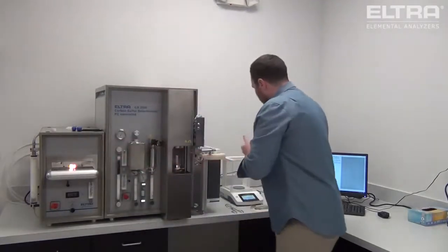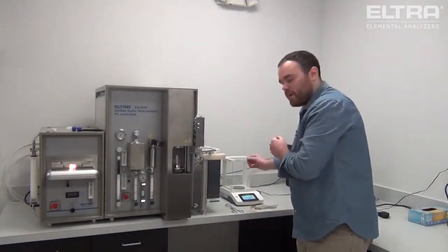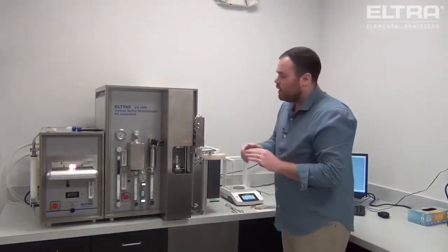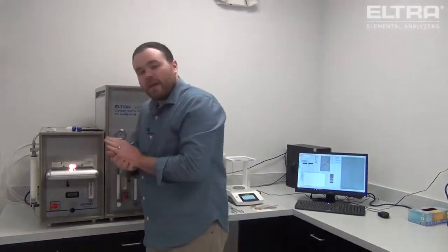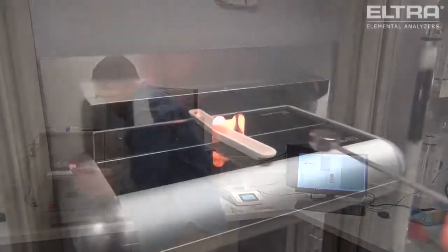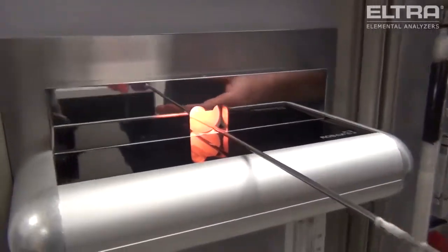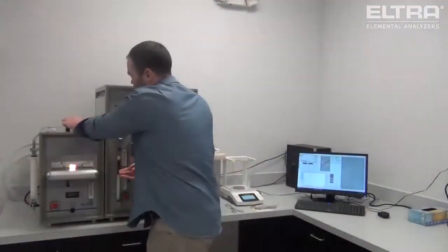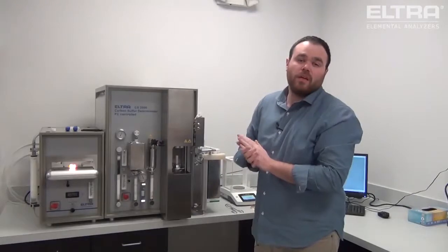You will weigh the sample on the scale, you can automatically show it to the software, and then when the analysis is ready to begin, you grab your sample insert, and you simply push the sample until it stops, pull out, and the analysis will begin on your sample.